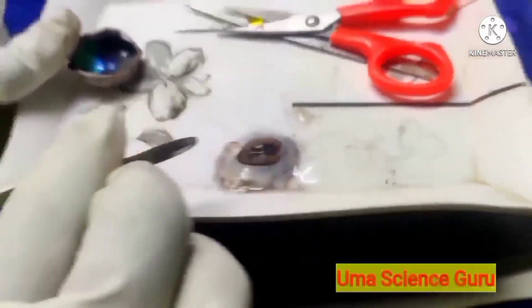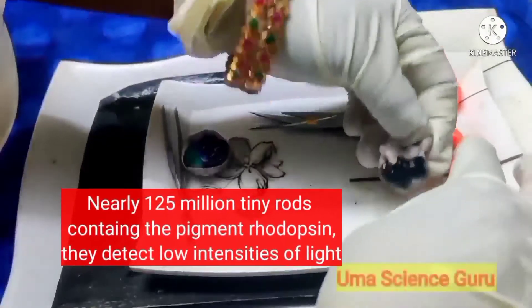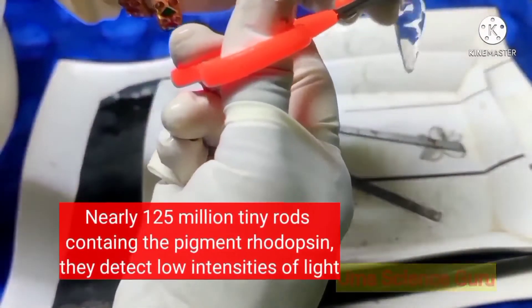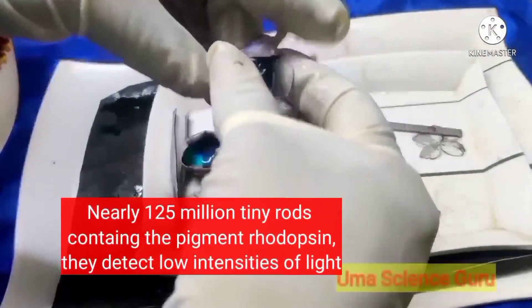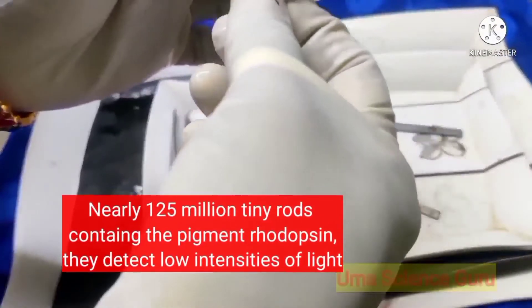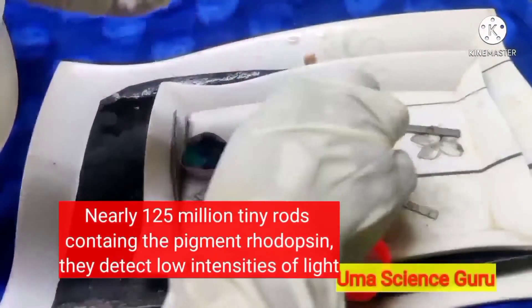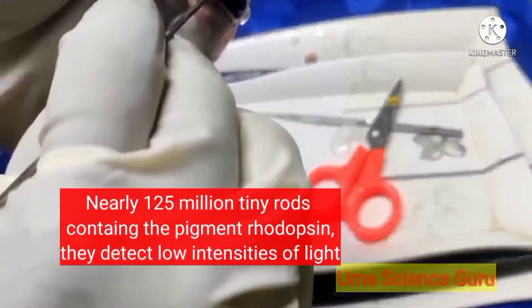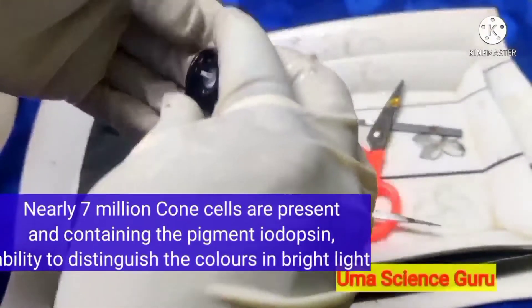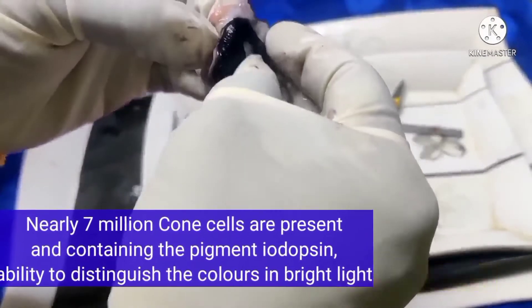There are two types of cells present in the retina: rods and cones. Nearly 125 million tiny rod cells are present in our eye; they contain a pigment called rhodopsin. They are special photoreceptor cells. Rods have the capacity to sense even very dull light in dark nights, but they cannot distinguish one color from another. Nearly seven million cone cells are present; they contain a pigment called iodopsin. Cone cells distinguish colors in brighter light.